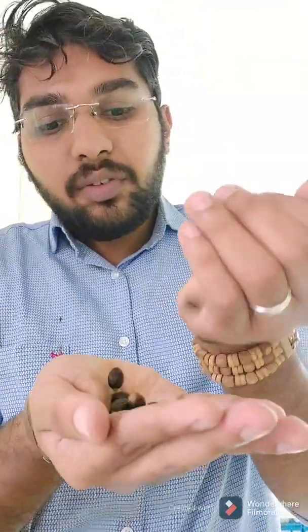Now, what are the requirements? Since it is an embryo culture, we require the seed or the fruit. Here I have taken a fruit — let me show you. This is the fruit I have taken. From this I am going to remove the fruit wall to get the seed, and I am going to break open the seed and show you the embryo. That is the first thing we require — the explant.